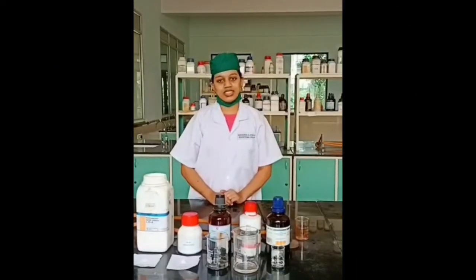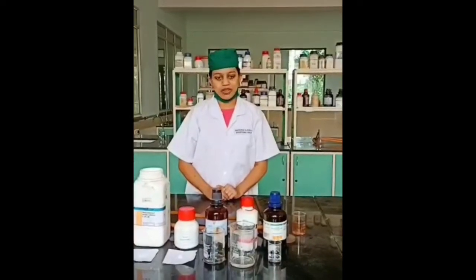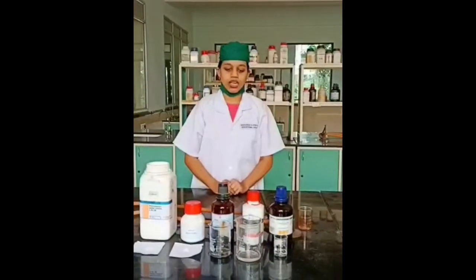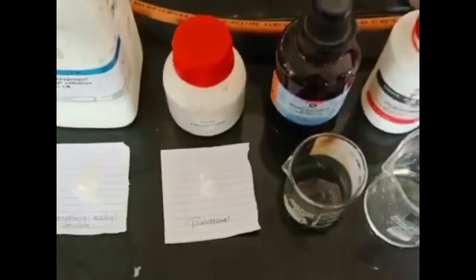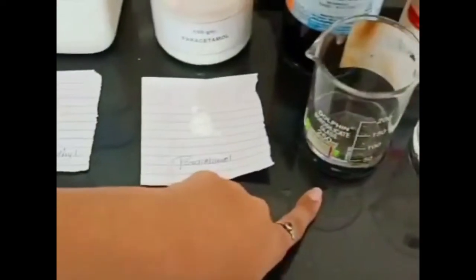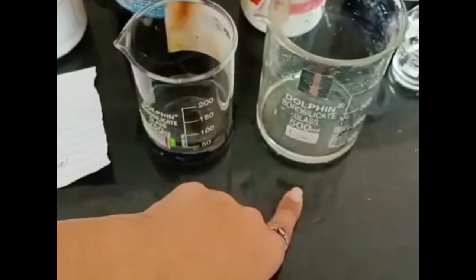Hello everyone, my name is Nikita Shinde, student of Shivaji Rao S. Sundari College of Pharmacy. Me and my coordinators are here to perform the experiment of muco-adhesive patches of paracetamol. Now I am going to show you the chemicals involved in this experiment: hydroxypropylmethylcellulose, paracetamol, methyl acetate, polyethylene glycol, and dichloromethane.